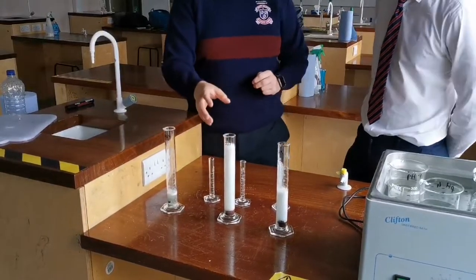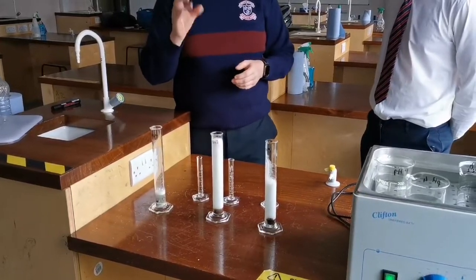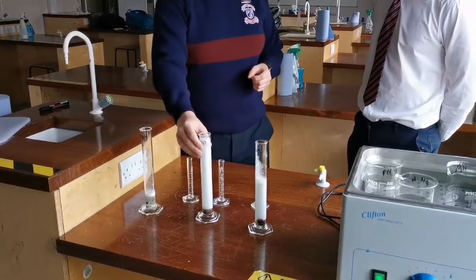We're looking for the one that produces the most amount of foam, and you can clearly see it's pH 9. That basically means that pH 9 works best on the piece of liver in this test tube.